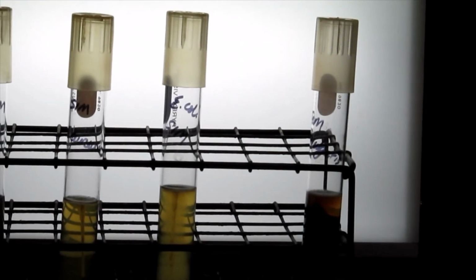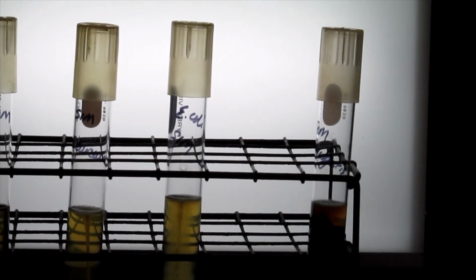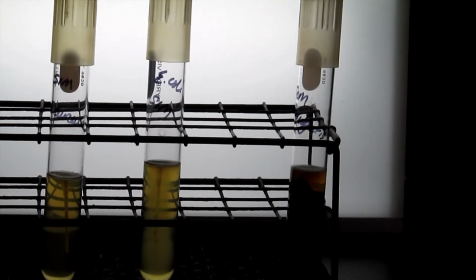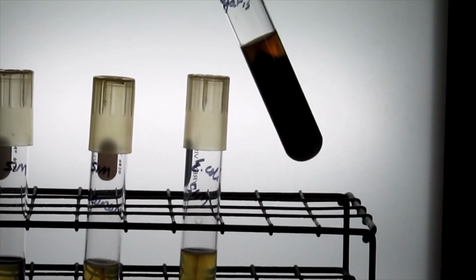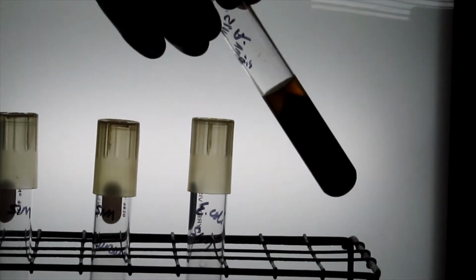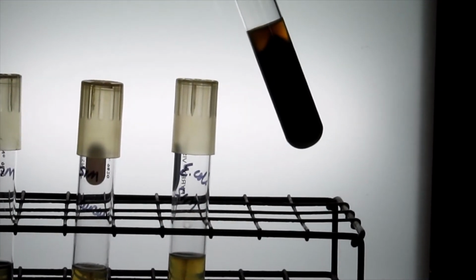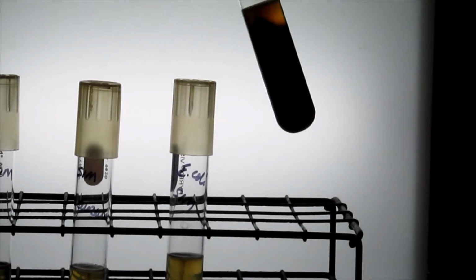Another phenotype that you can look at is whether or not the bacteria can produce hydrogen sulfide. We mentioned that there are two components in this media that allow for the production of hydrogen sulfide. That is the sodium thiosulfate and the ferrous ammonium sulfate. And if hydrogen sulfide is produced, it will come out of solution and give this black pigment. So in this case, because the black pigment is also away from the stab line, you say, oh, the bacteria is both motile and produces hydrogen sulfide.